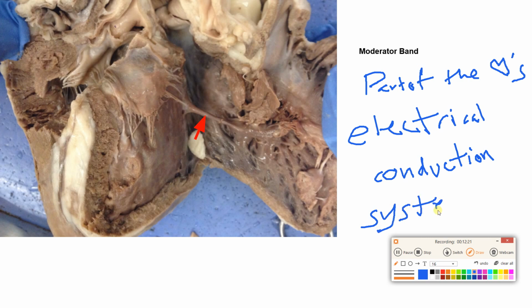Did we mention a moderator band when we did the human heart model? No, we did not. Humans have a moderator band, but it's not as dramatically big as that of a sheep. In humans, the moderator band is often called the septomarginal trabeculum, and it's smaller. So our heart model actually does not show it to us. So that's the moderator band. Cool, cool.